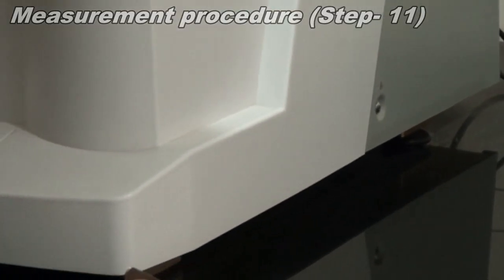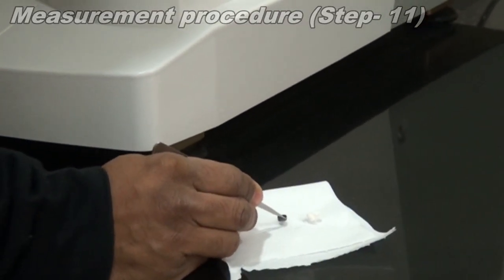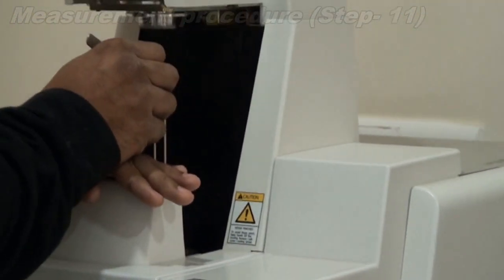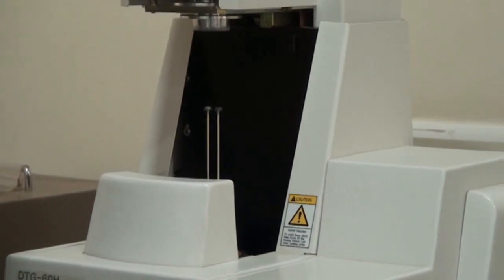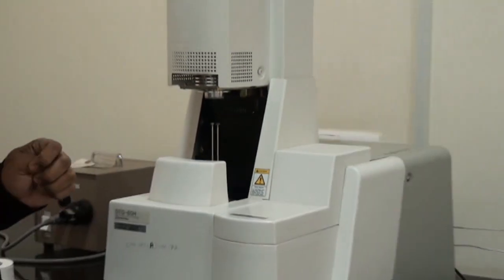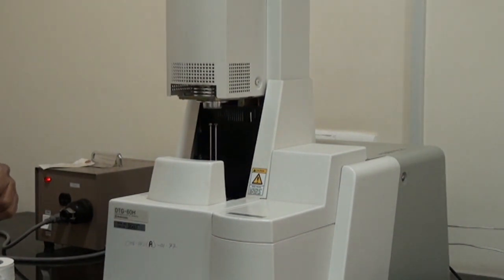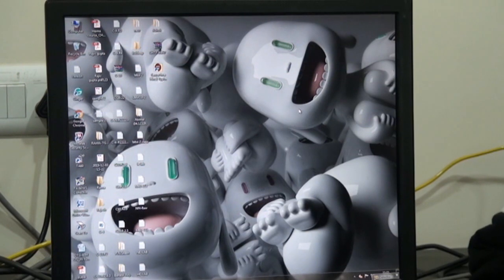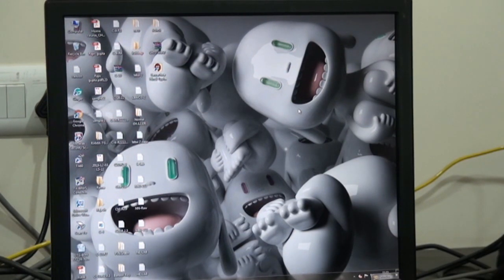Once you ensure it is completely cleaned, you keep it back in the original place where you had taken it from, and close the furnace. Once the measuring procedure is completed, we need to go to the data collection step.